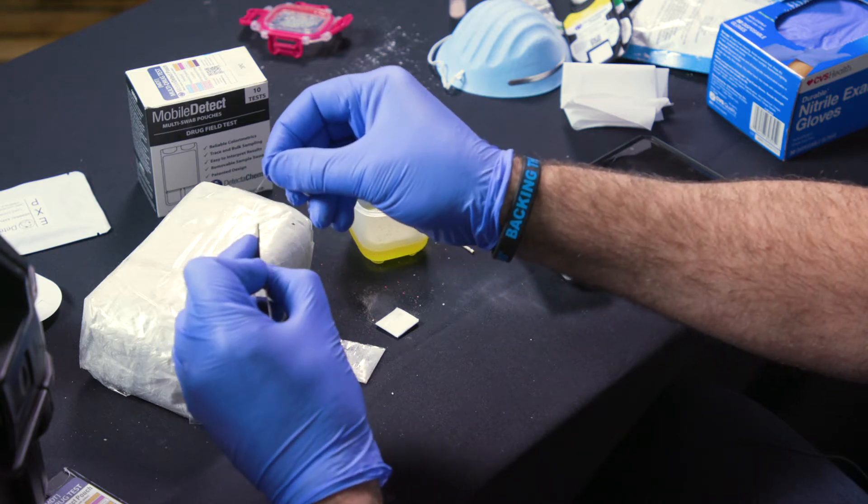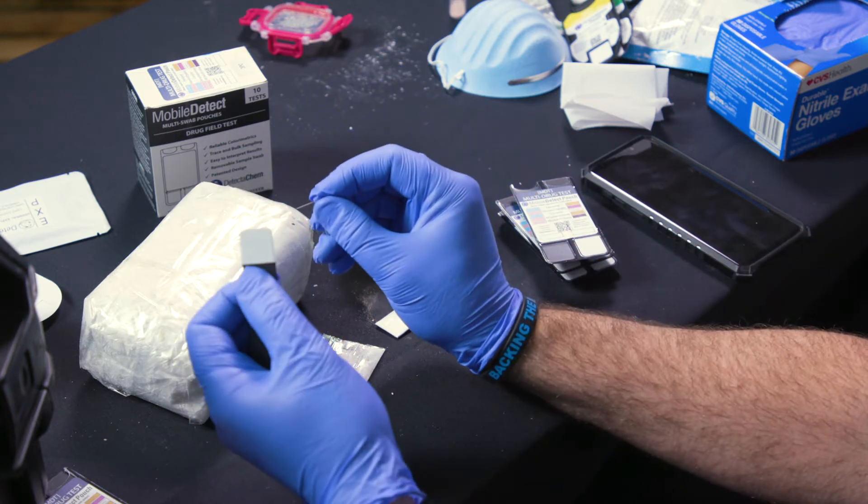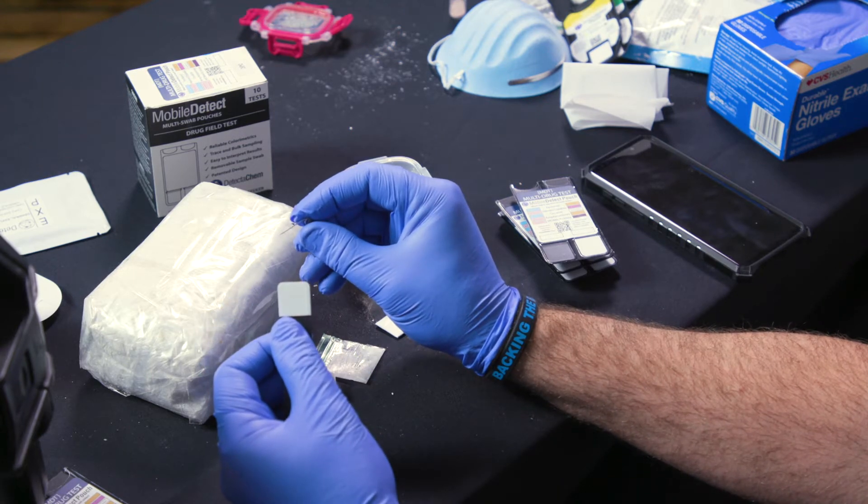Swab just the tip of that pin or knife whatever you've used to puncture in there. That is all you need to go to then use the pouch to get a determination of the drug that's inside.